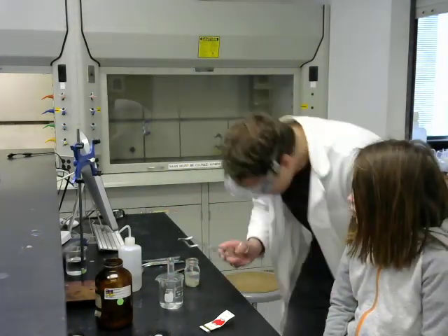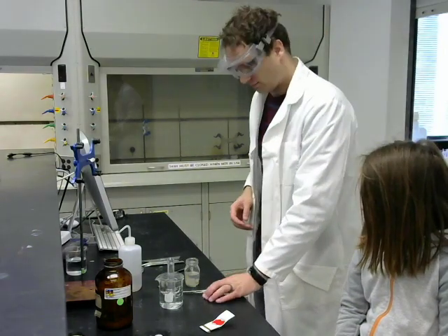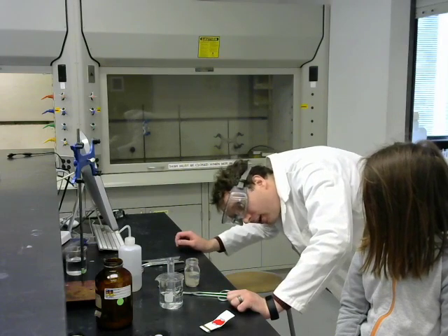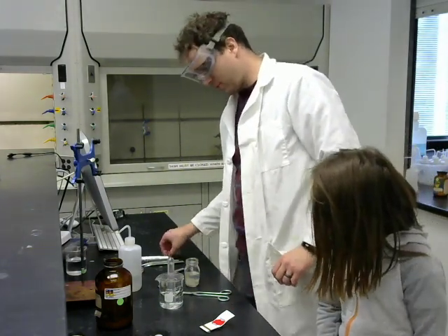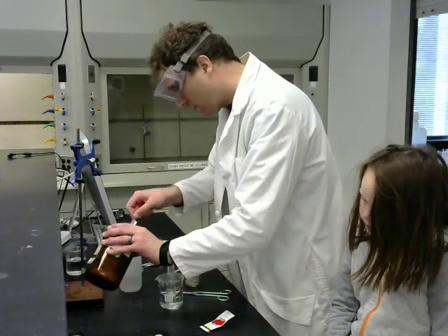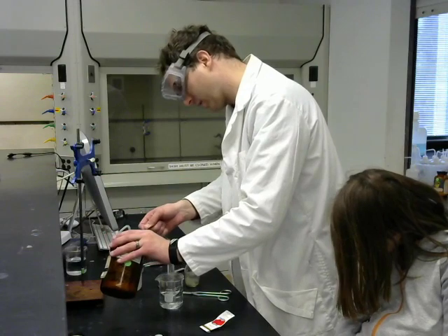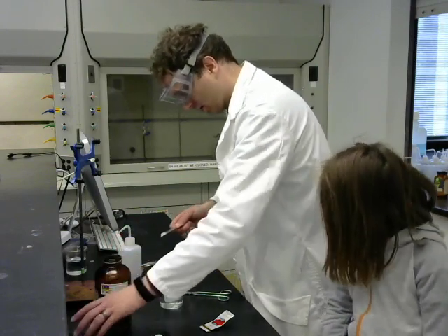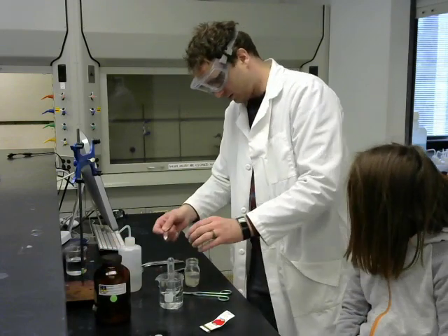It is, however, generating bubbles. If you look down there, the calcium metal chip is now surrounded with bubbles, and they're slowly bubbling up. I want to make this go quickly, so I'm going to put in a few more calcium chips. That's three. We get to play fast and loose here.